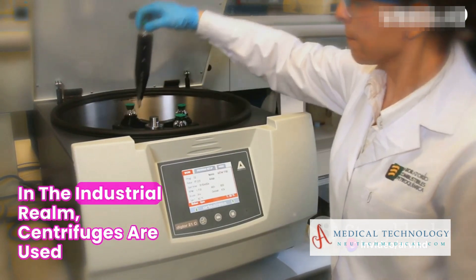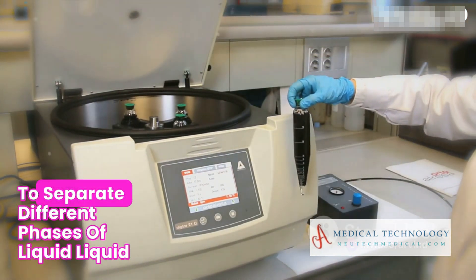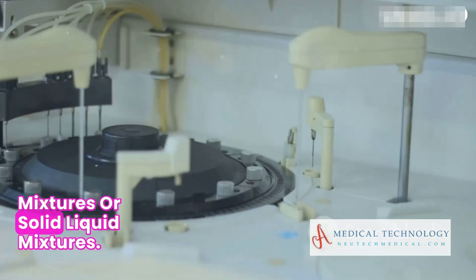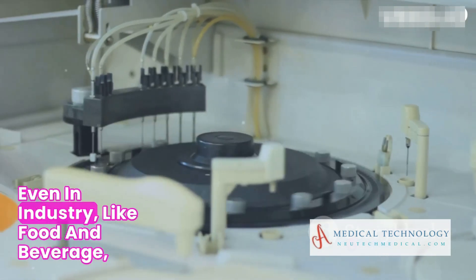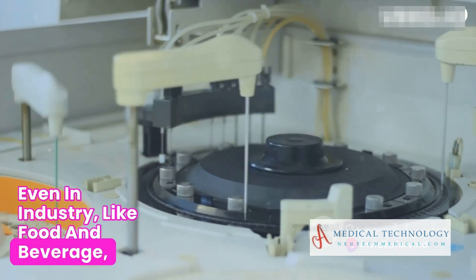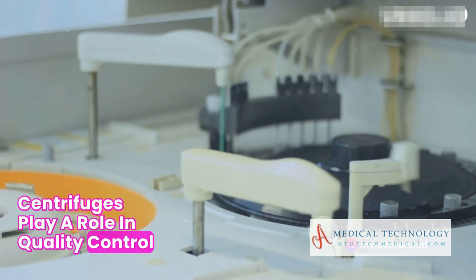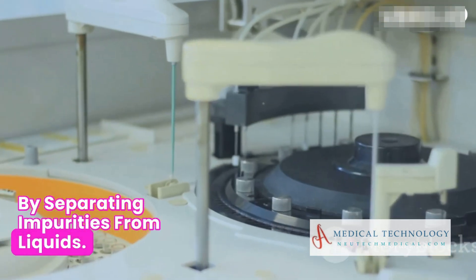In the industrial realm, centrifuges are used to separate different phases of liquid-liquid mixtures or solid-liquid mixtures. Even in industries like food and beverage, centrifuges play a role in quality control by separating impurities from liquids.